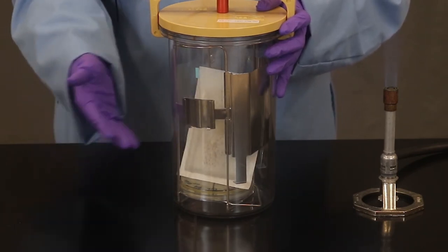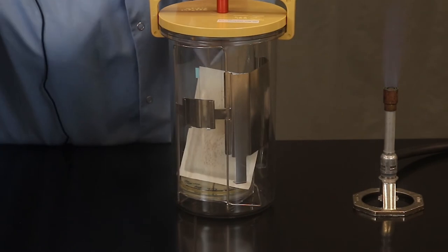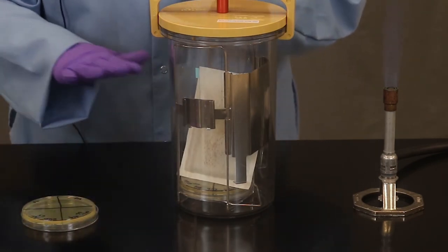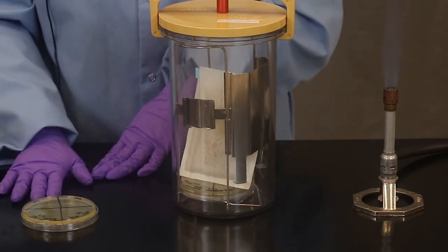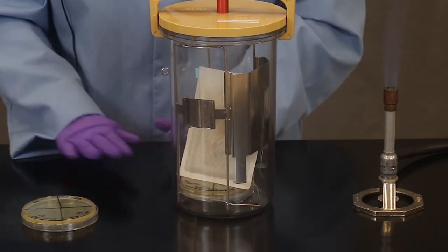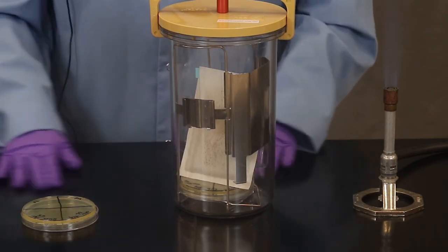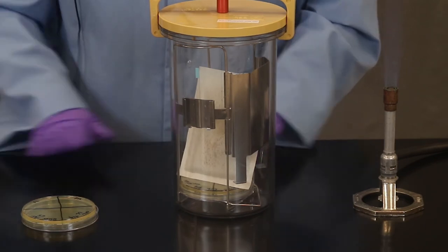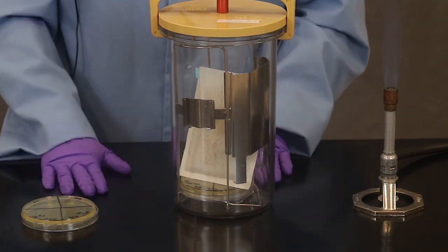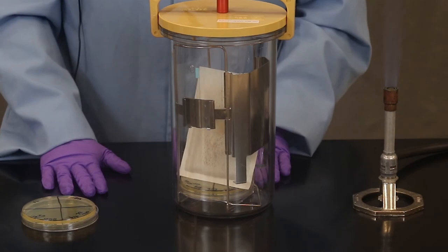And when we come back on the second day of this experiment we'll see which bacteria grew on which plate. In some cases it will only grow on one. In some cases it will grow on both. And we're going to explore the different oxygen requirements bacteria have which is quite a large spectrum. So we'll take a look at these during the second portion of this video.